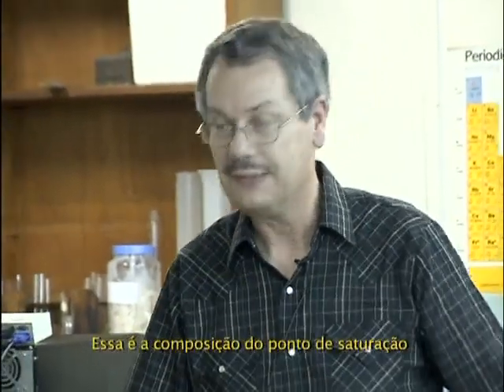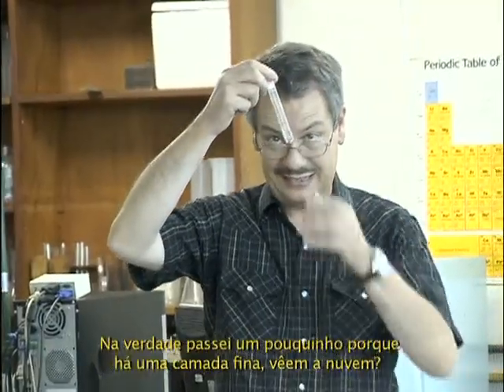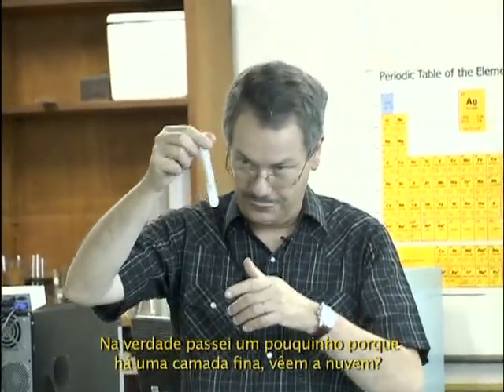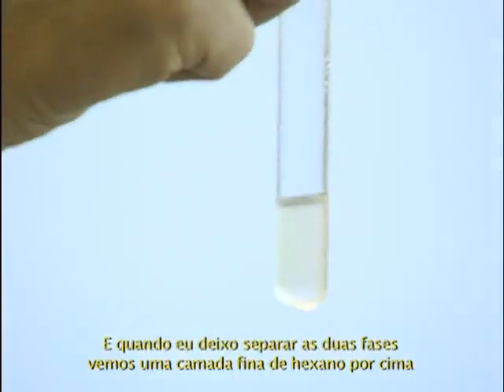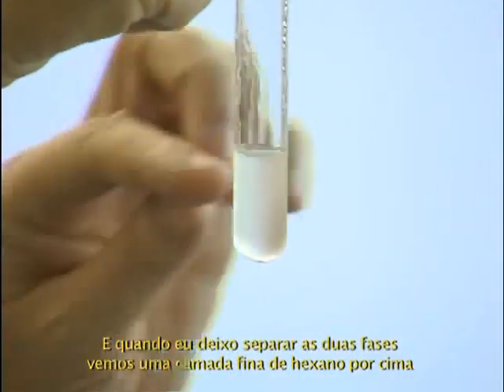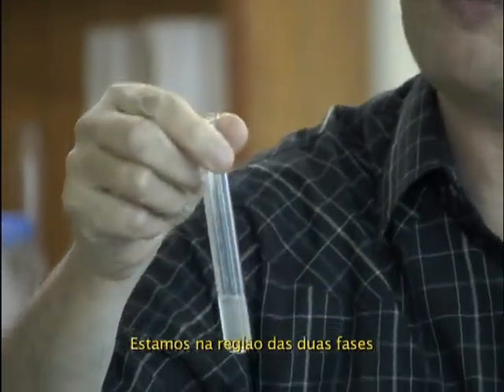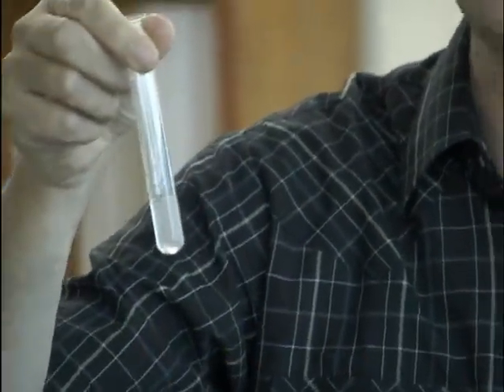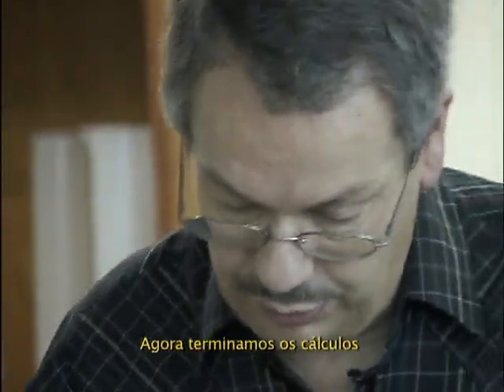So this is the binodal composition, and actually I even passed it a little bit because I have a thin layer. See the cloud? And when I let it separate, you see a thin layer of hexane at the top. So we are in the biphasic area. Now we finish the calculation.